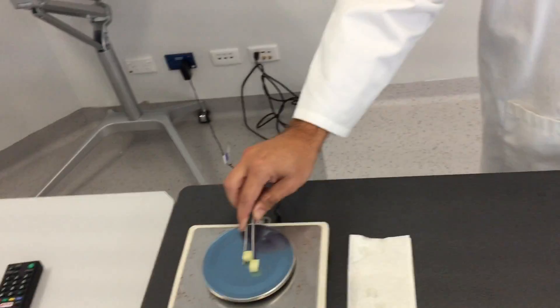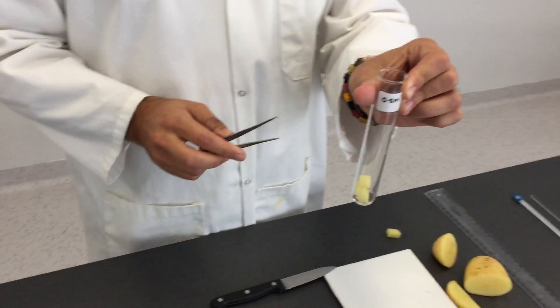These are then transferred into a test tube while we prepare the sucrose solution.